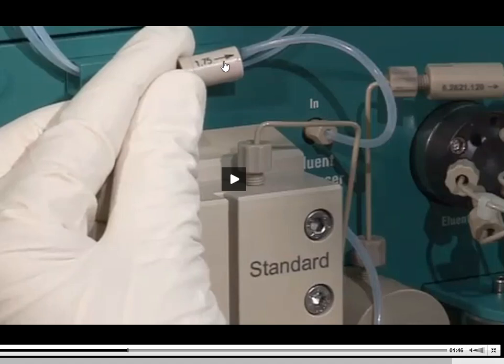And if it does get gunked up too much, you might as well just go ahead and replace them, because it's going to be very hard to clean these out. It's almost going to be impossible. You can put them down into some methanol. You can put them into an ultrasonicating bath if you want to. But quite honestly, once these get to the point of no return, they really are no return. It's going to be easier just to trash them and replace them with a new one.